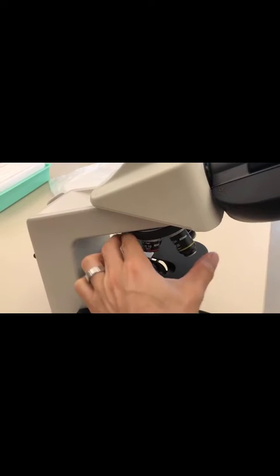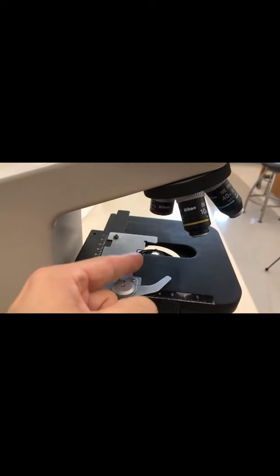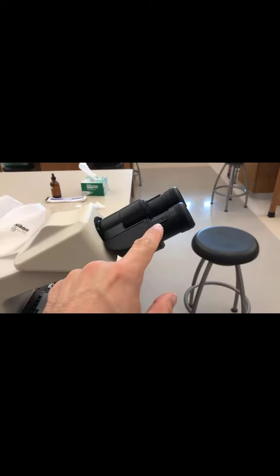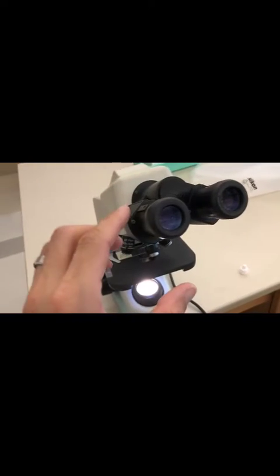You want the 4x scanner to be engaged always. When you start the microscope, you want that to be in the light path. These right here are the oculars or eyepieces, and they also magnify the image. It says right here, 10x.